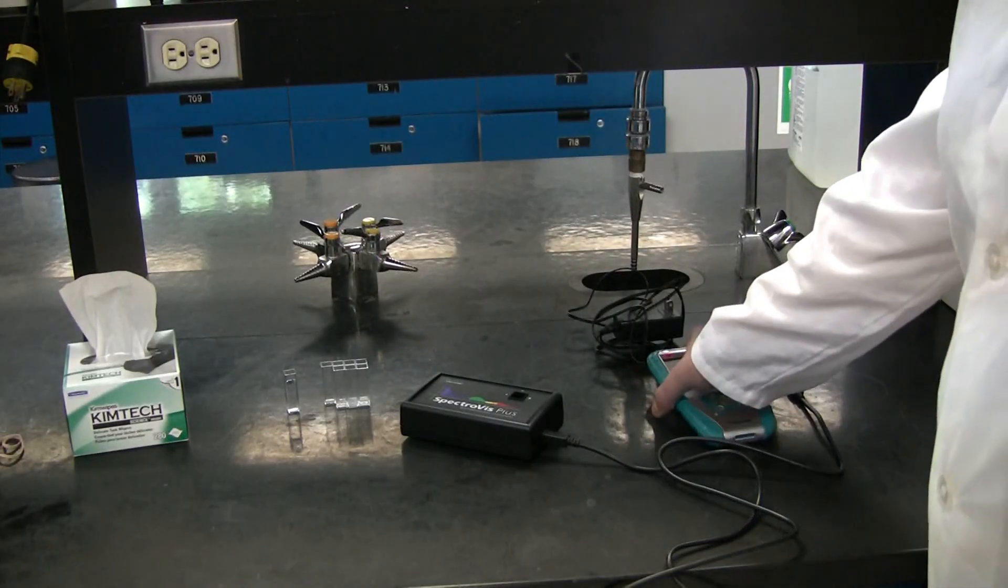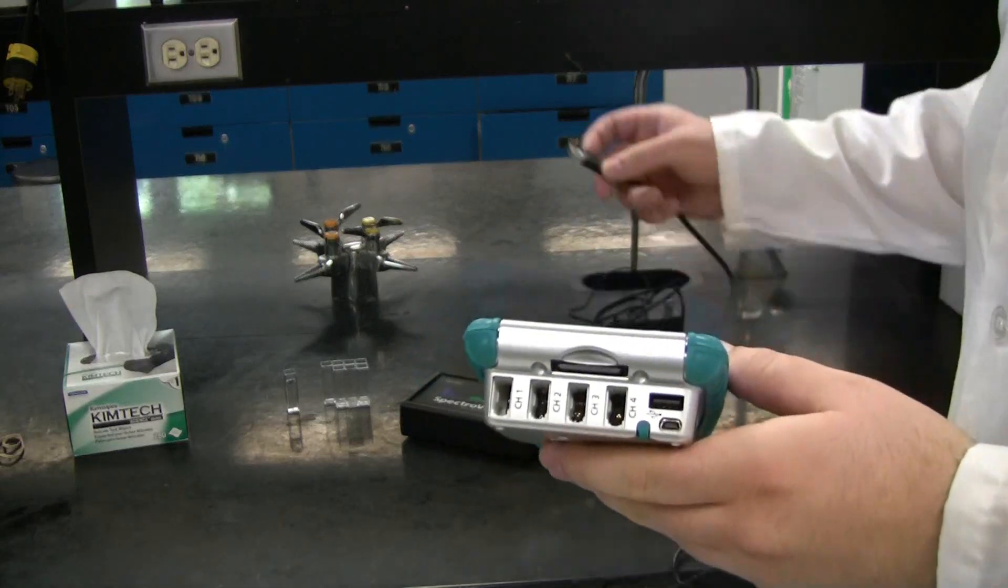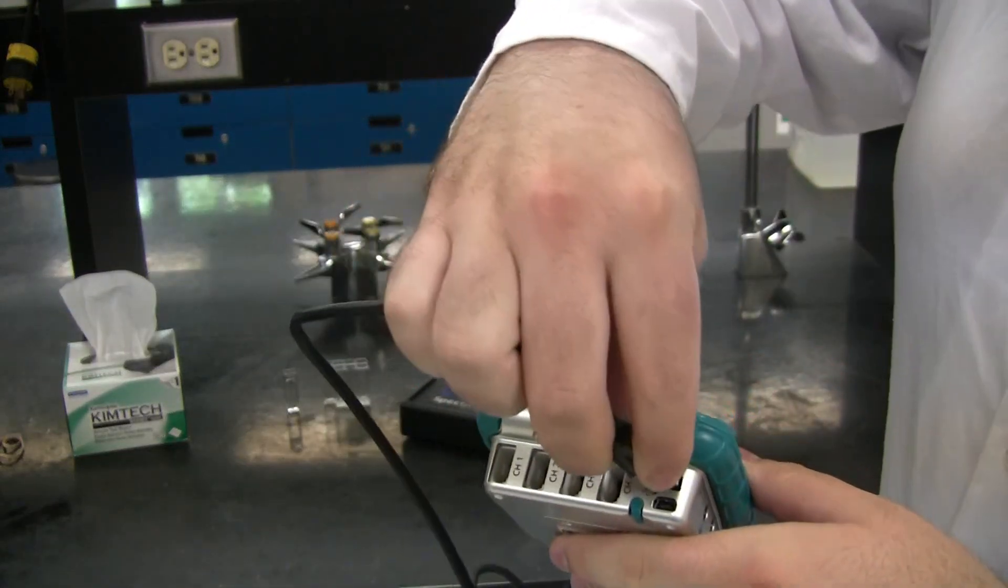Start off by taking the LabQuest and plugging in the SpectroVis Plus cable right here.